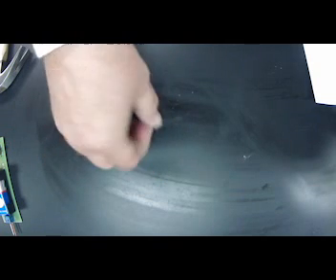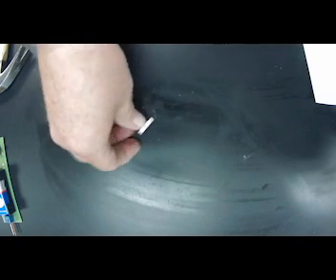So let's see. Here's my magnesium, okay? It's got some luster to it, some shine, okay? It is kind of like a light gray, okay? Other physical properties, I can bend it, actually, okay? It's in a ribbon. It's flat, okay?